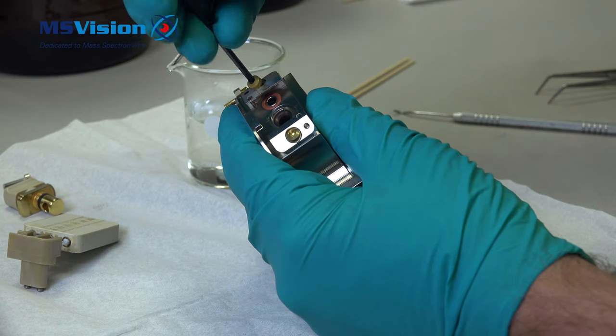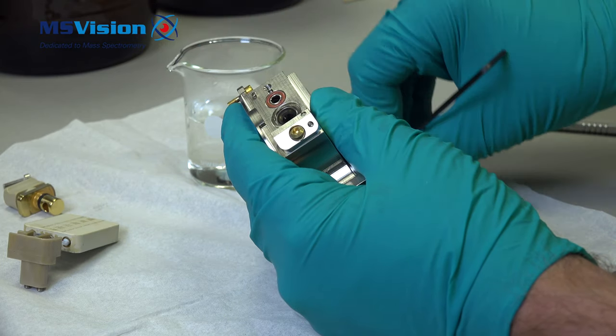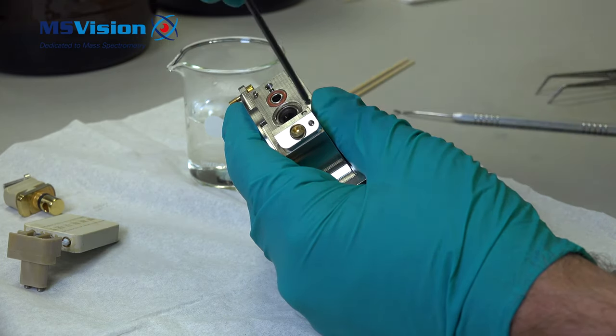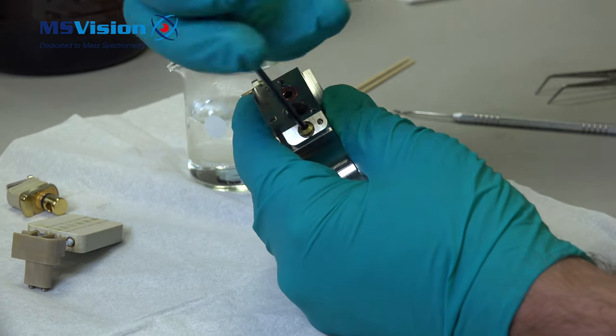In order to be able to remove the red o-ring we can remove the two cone fixings. This also makes them easier to clean.